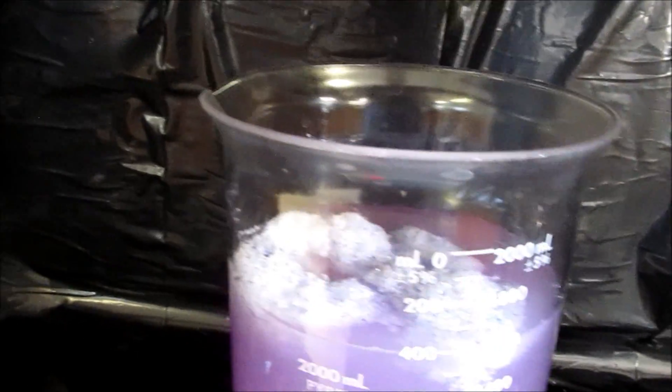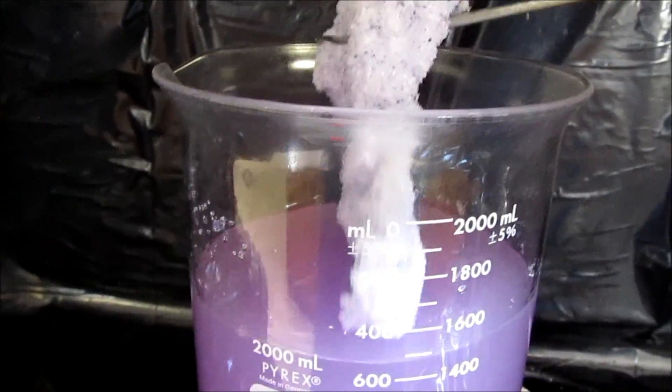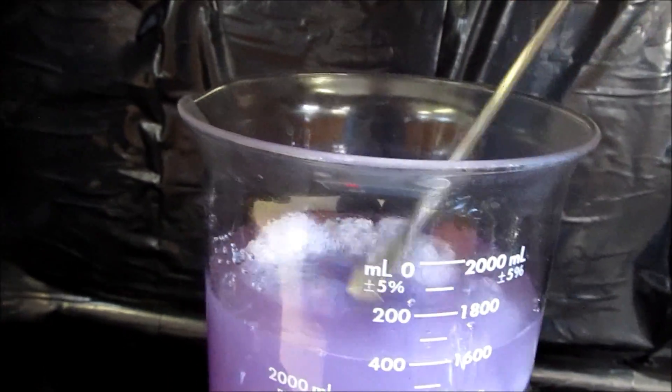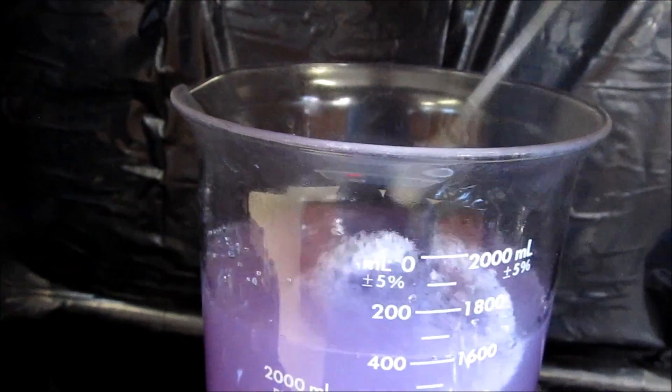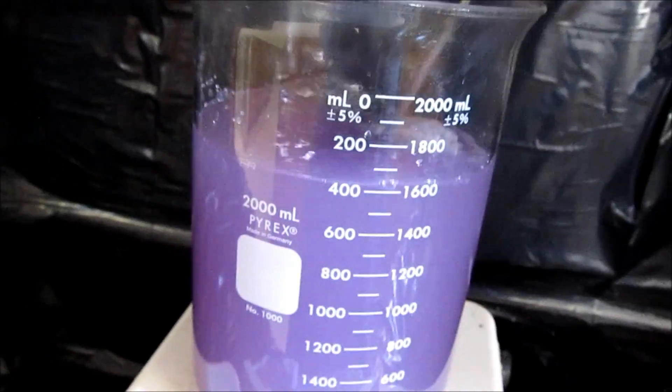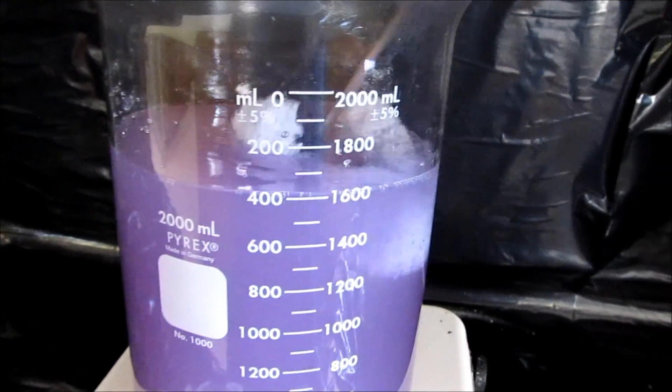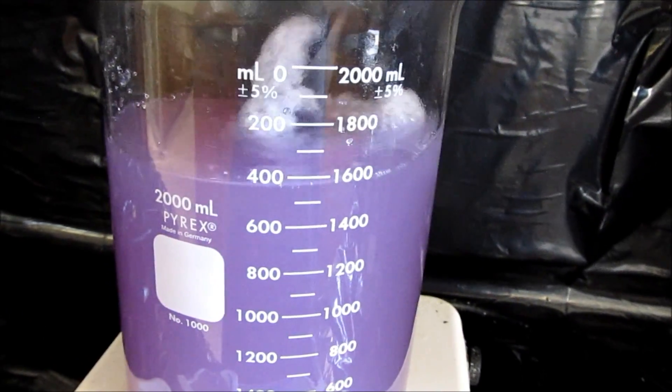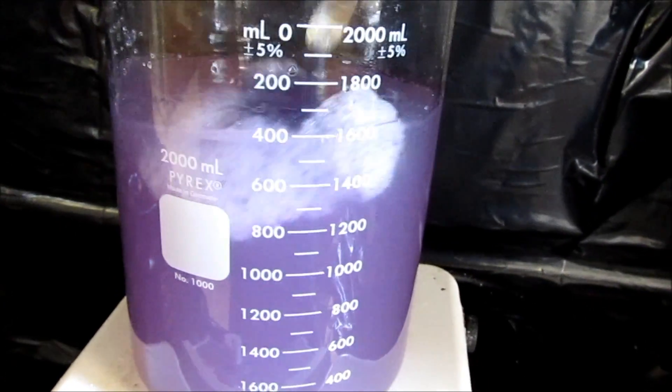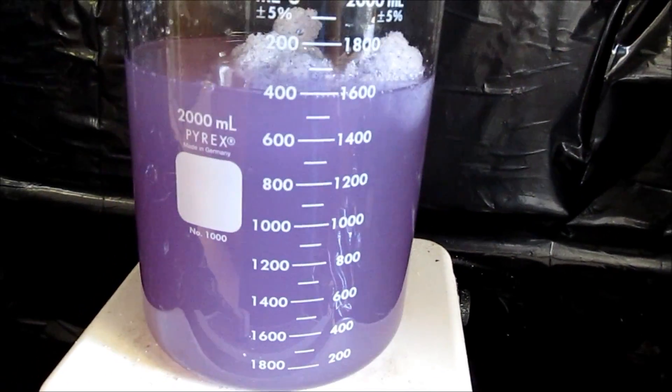I've still got a pretty good glob of silica gel. Now it just slowly melts away. And then that milkiness, I think it's caused by bubbles, probably hydrogen. Eventually that'll clear away. I'll have a relatively clear solution, a little purple tint.